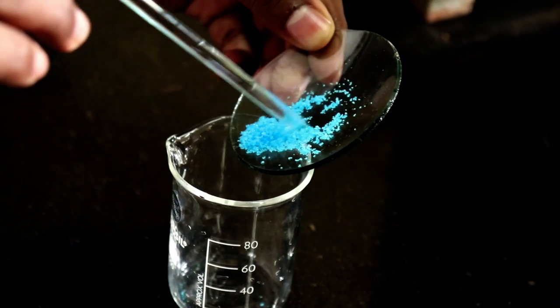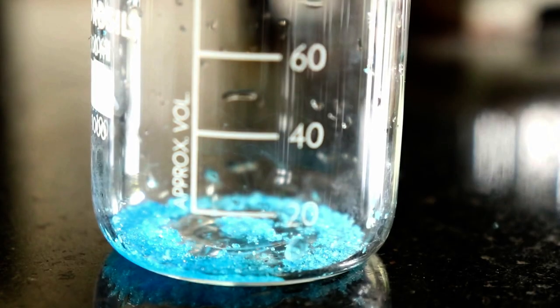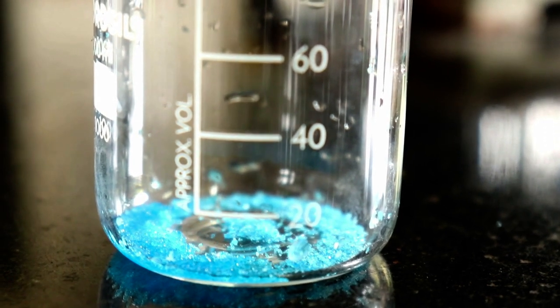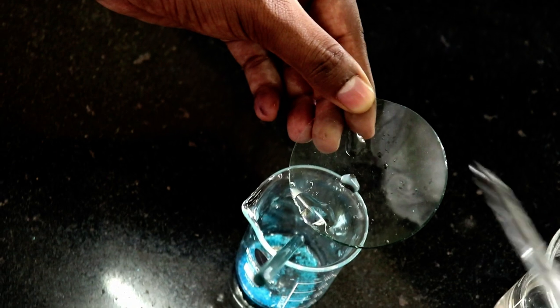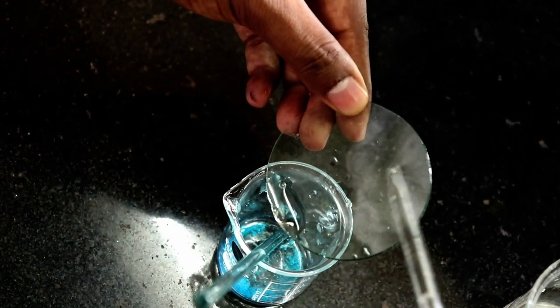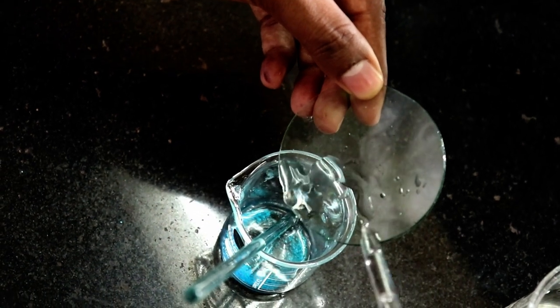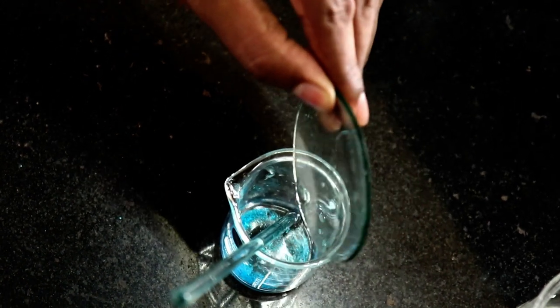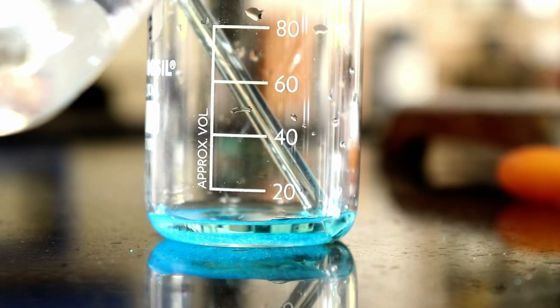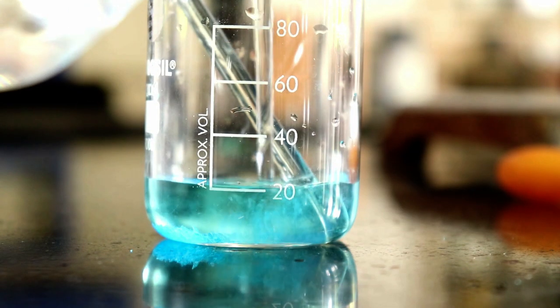Like this, now pour some water on the watch glass with the help of a dropper and collect the water in the beaker. Add 20 to 30 ml of water.